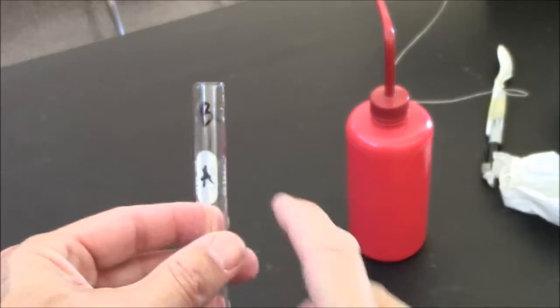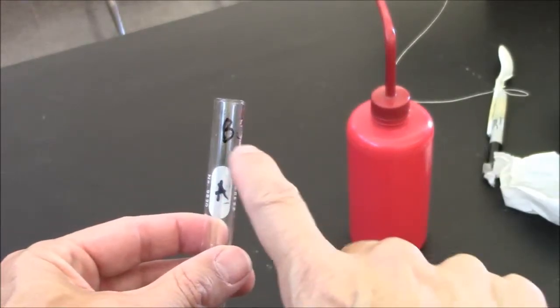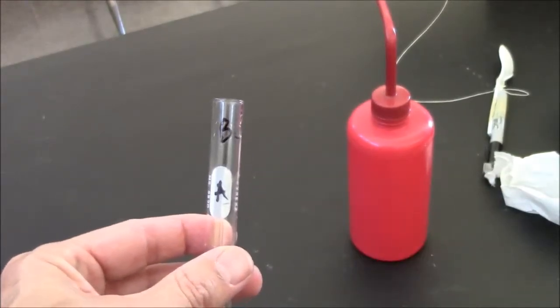When you label your tube, please don't write on the white part. Write on the glass. Makes it much easier to erase.